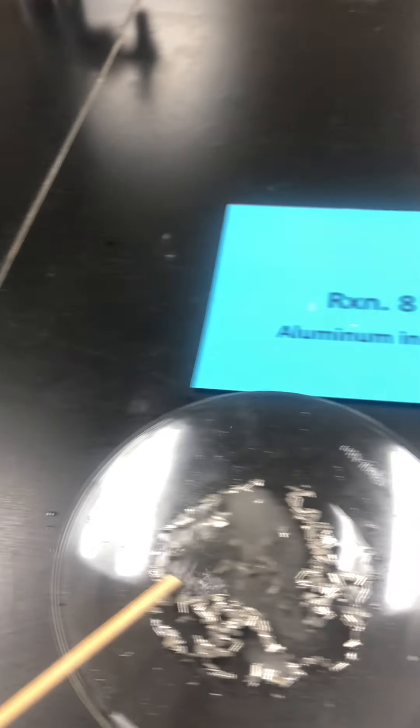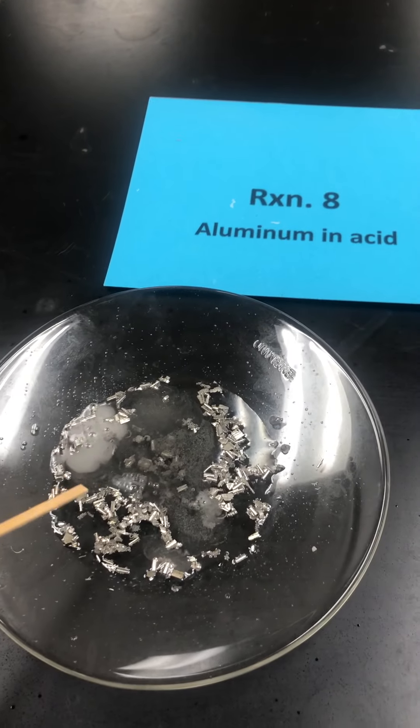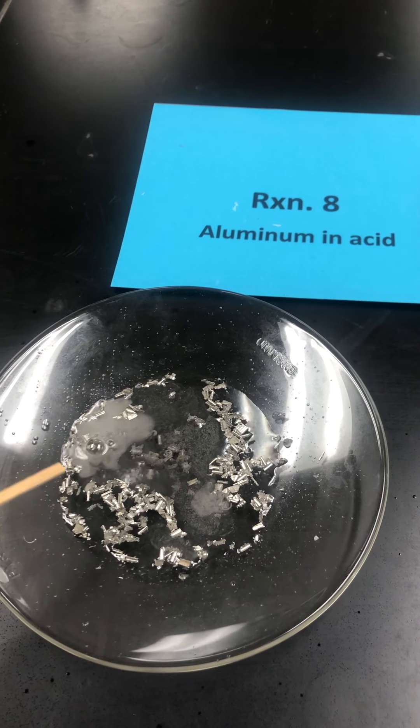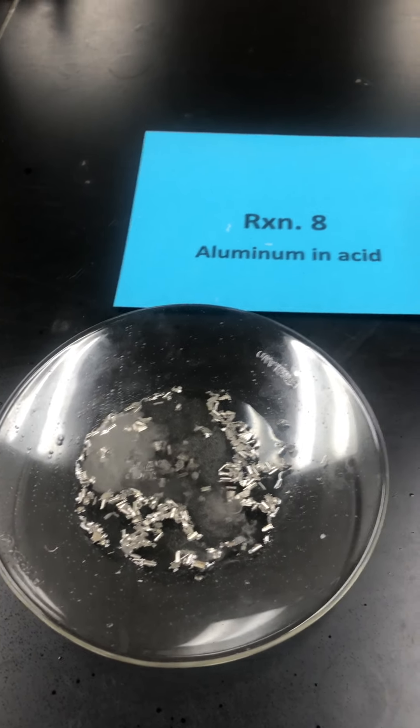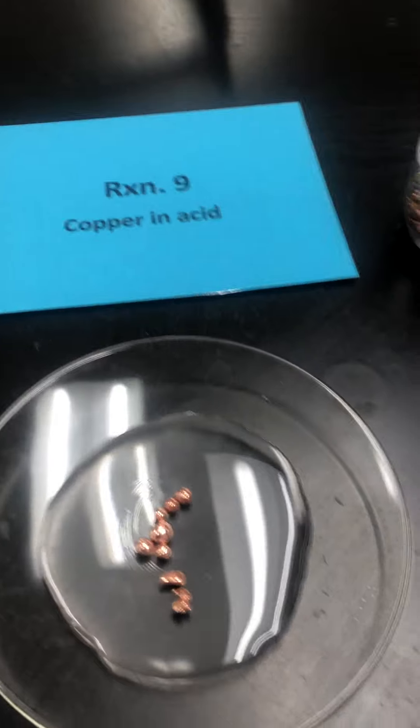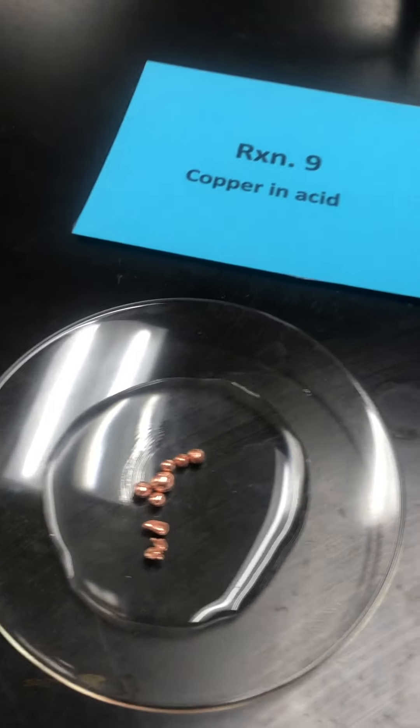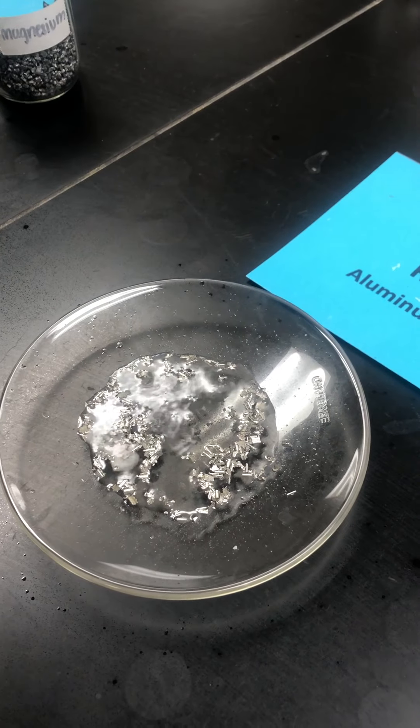So you can see now after a good lag time of a minute, the aluminum has also generated a gas. Now I wish I could show you which gas it is by doing a test, but you'll have to analyze that from the chemical reaction itself. I'm not capturing this gas as it's generated.